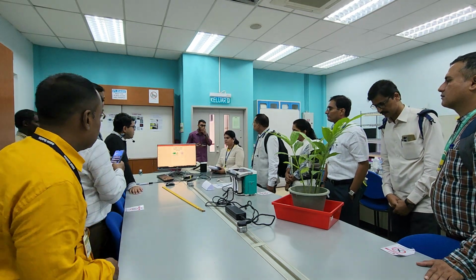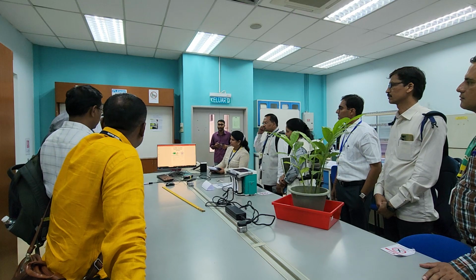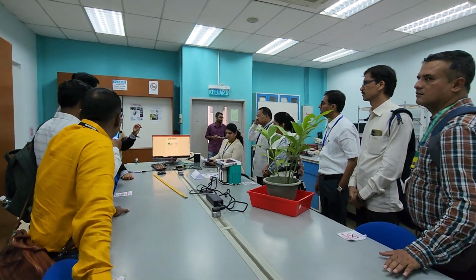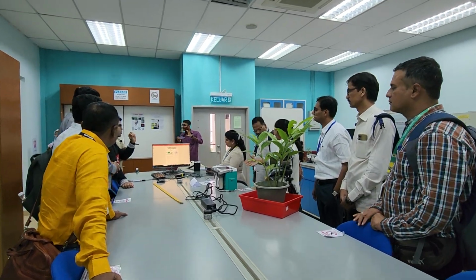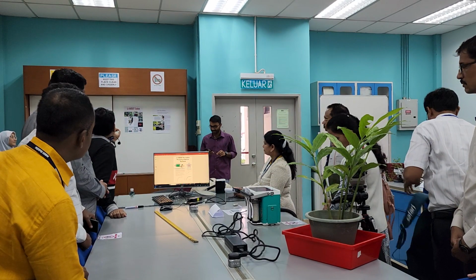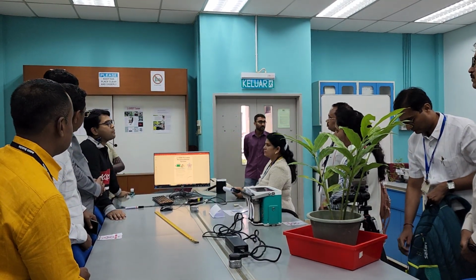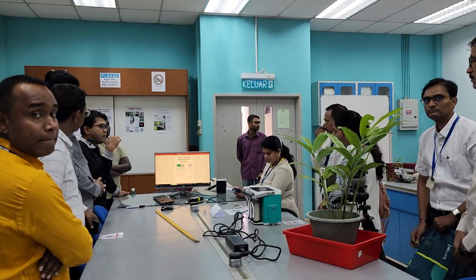Right. Okay, so welcome to Physiology Lab. So in here, we have a number of equipment that are ready for demonstration. So mainly, we're going to talk about five equipments that are regularly used to understand the functions and also the mechanism in the plant.